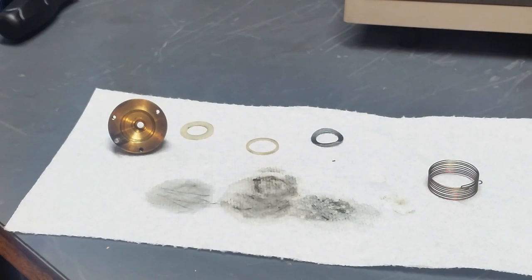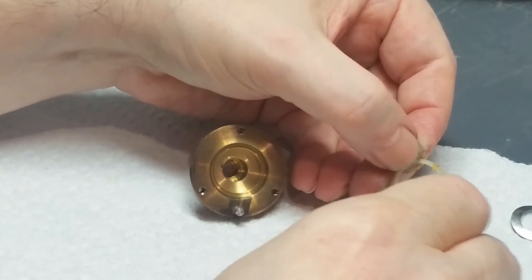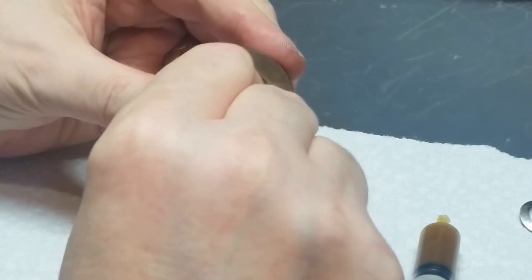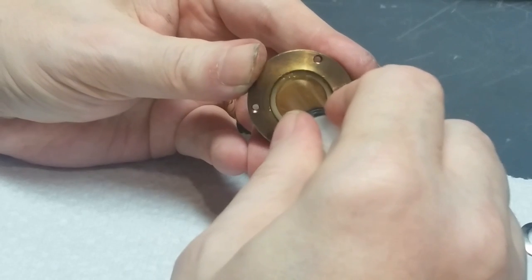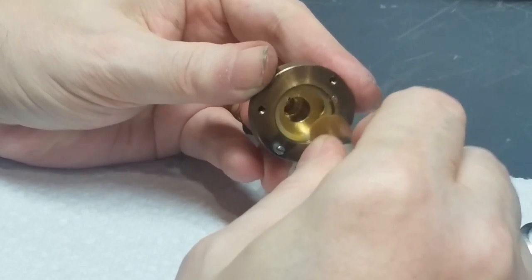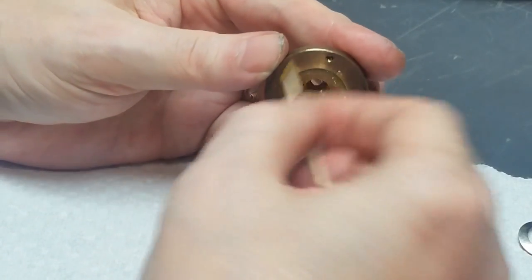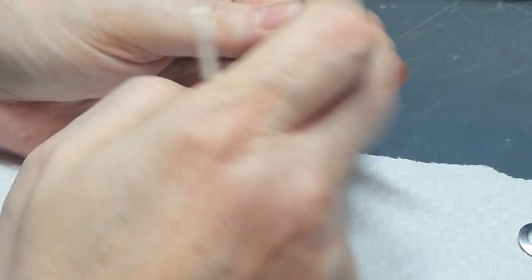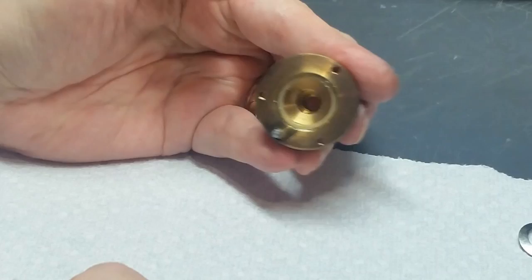Okay, those are clean. Let's put the thing together. All right, here we go. Let's do a little bit of plastilube grease on the back side of this thrust washer. This little guy goes inside of here, and once you seat it, put another light coating of grease on top of it. Spread that out a little bit and wipe off any excess from here. Doesn't need to be there, it just messes things up. Okay. So basically that's ready to go.